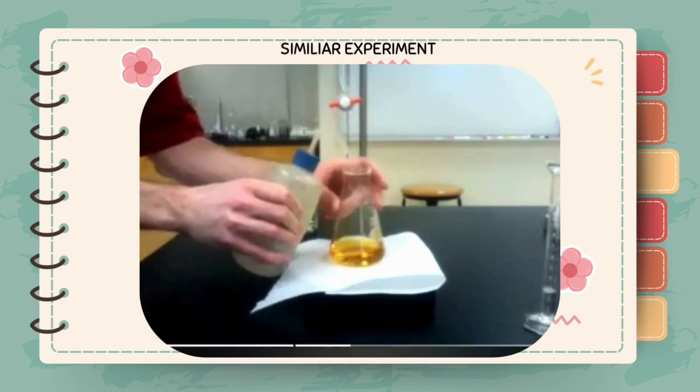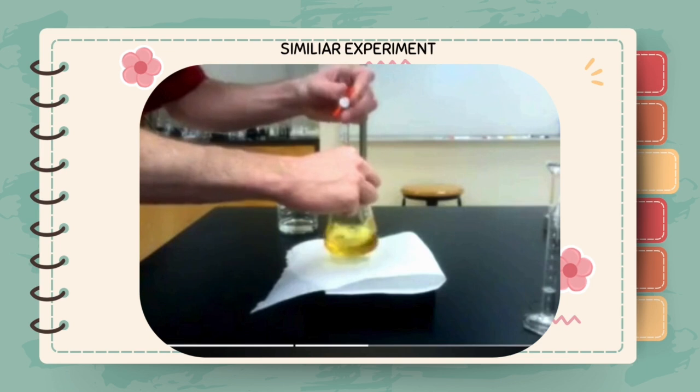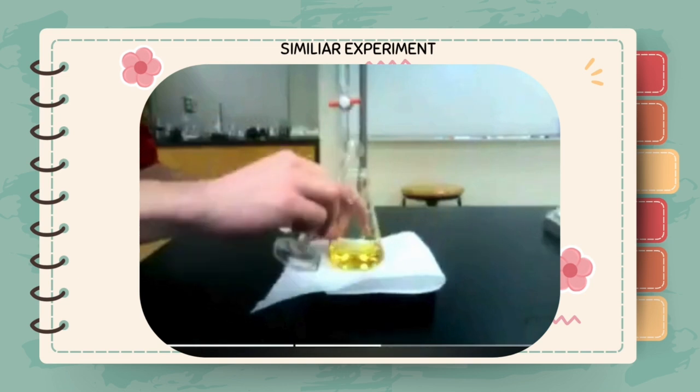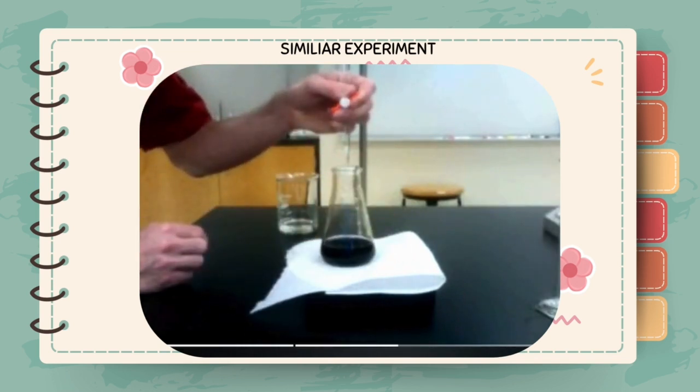As you will see through this titration, the initial color of the solution is a golden yellow. As you proceed through the titration, it will become lighter and lighter to an almost pale yellow color. When you've achieved the pale yellow color, it's time to add the starch indicator. The indicator will greatly change the color of the solution, making the visualization of the endpoint much easier. As you can see, the addition of starch turns the solution to an almost black-blue color. This color will disappear and become completely colorless when you reach your endpoint.